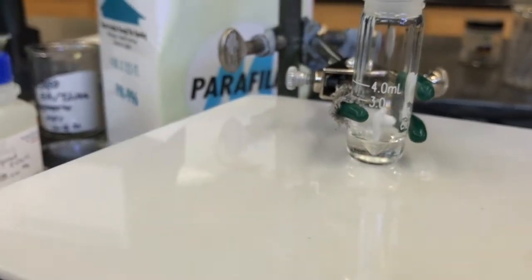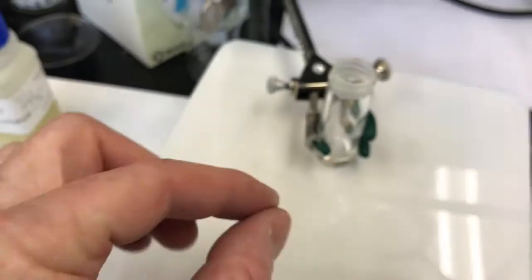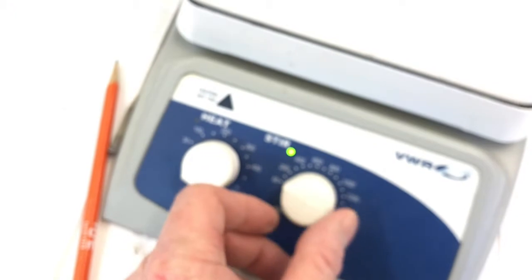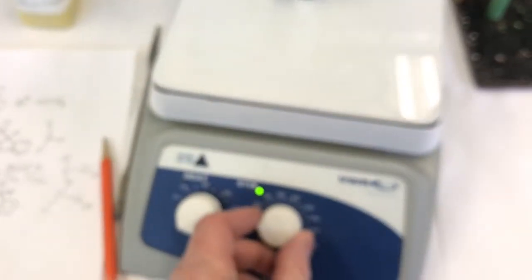And you want to stir the solution just enough, not too much. A lot of times students do this initially. They'll turn the stir plate to full blast. And then what will happen is the magnet just can't quite catch. This one's actually doing okay. But a lot of times it'll just kind of jiggle, which actually might be enough to stir the solution, but if you want it to stir nice, you just kind of start slow, get it going, and then go back. Sometimes the stir bar just needs to break that coefficient of kinetic friction to start, and then it'll keep going, and you can slow it down. All right, so you know how that works.